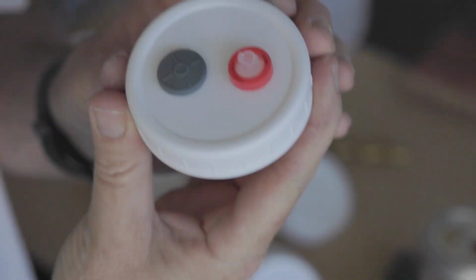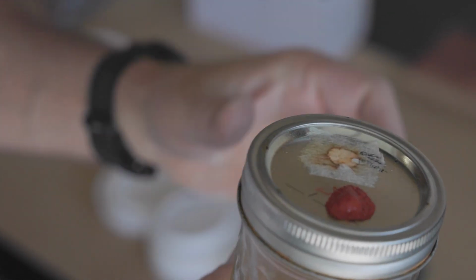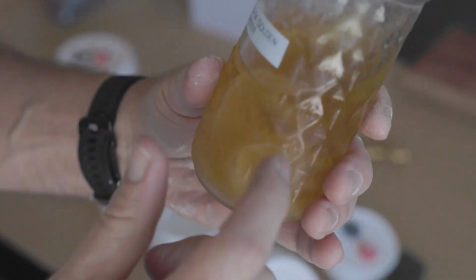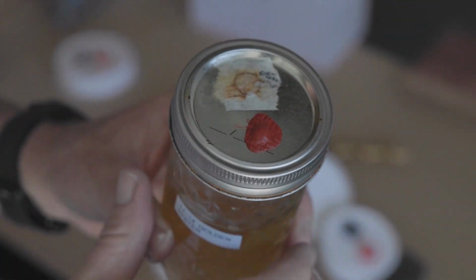Today we are going to build this, which is an upgrade to this. If you guys don't know what it is, why are you watching this video? Anyways, for those in the know, this is the liquid culture that I have. Got some golden oyster here, but nevertheless, this is getting a little gunky up here. It's getting a little rusty or whatnot.